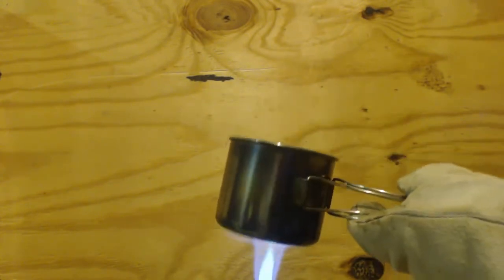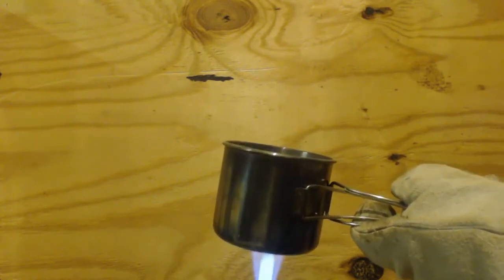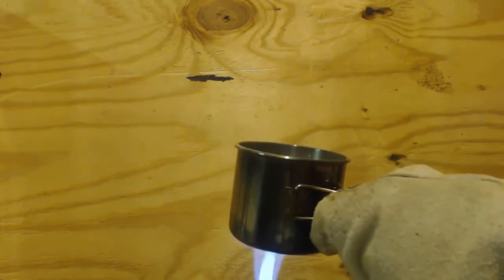Alright, I tried doing this on the oven. It didn't work very good, so I switched it over to this propane setup here, the Bunsen burner. It didn't work very good either. What did work good, see, I got my product in here, right? Oh, you can see that. I want to dump it. Anyways, I put it on the hottest part of the flame, and I got this.